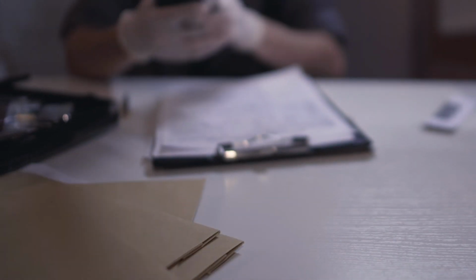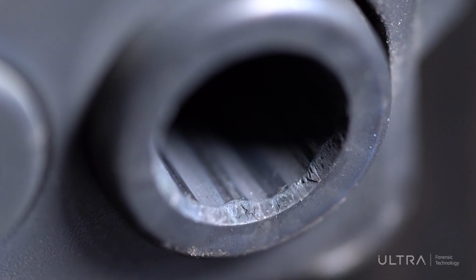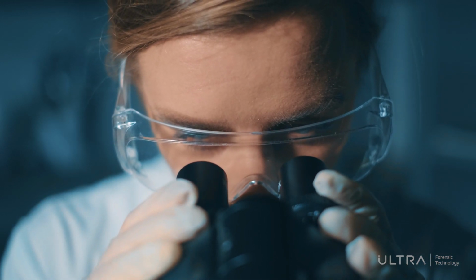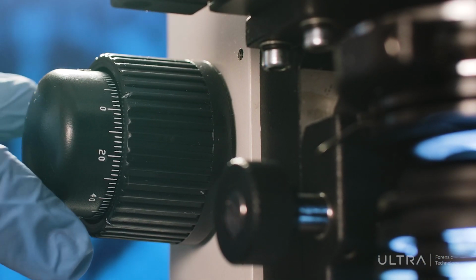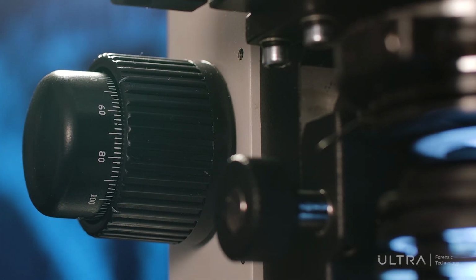Firearm and tool mark identification involves comparisons, such as the rifling marks on bullets, to determine if they share a common source firearm. Traditionally, examiners have used comparison microscopes to view objects two at a time. However, their use can be challenging and time-consuming, due in part to the frequent position adjustments and varying lighting conditions.